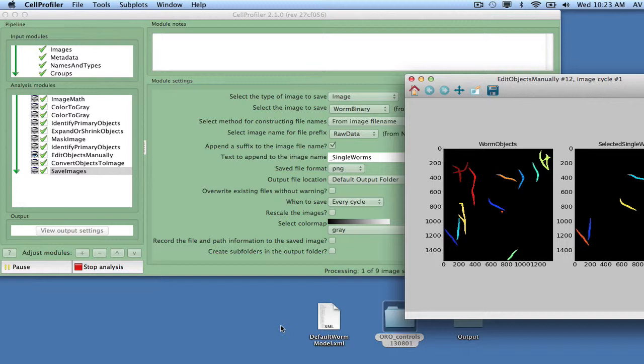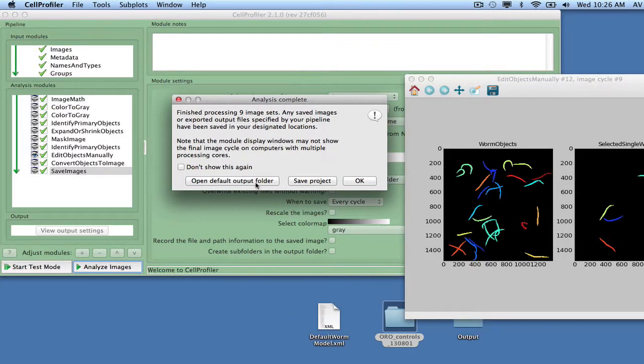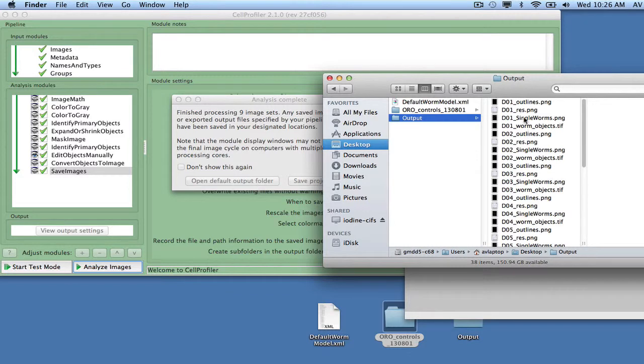As mentioned earlier, picking 40 to 60 worms that are representative of the variability of sizes and shapes observed in experiment is recommended for model training. At the end of the pipeline, the output folder will contain images of the single worms you have selected. It is wise to do a sanity check of the selected single worms when the analysis is done by browsing the output images. It is very important to include only true single worms during the training, as non-single worms will make for a less accurate model. Any errors can be corrected by rerunning the pipeline using that particular image as input.